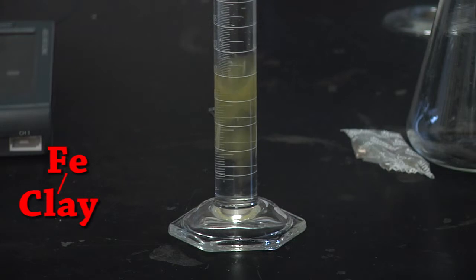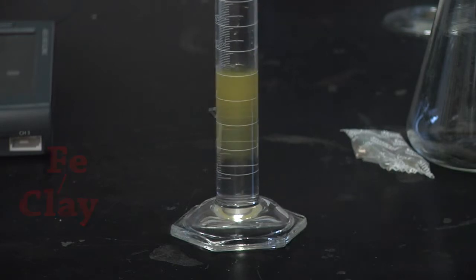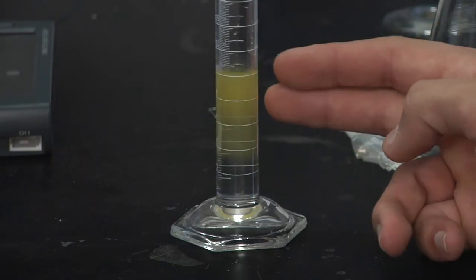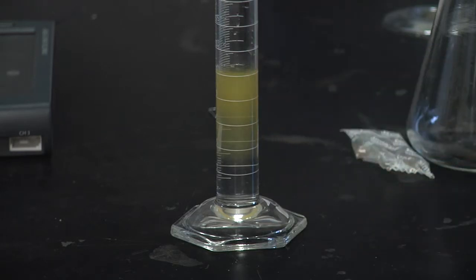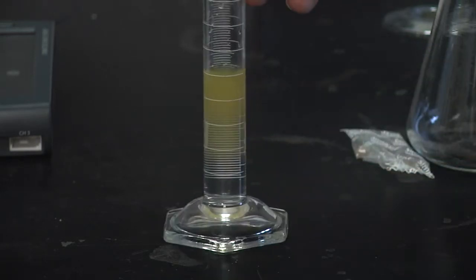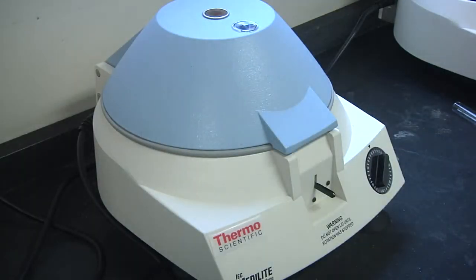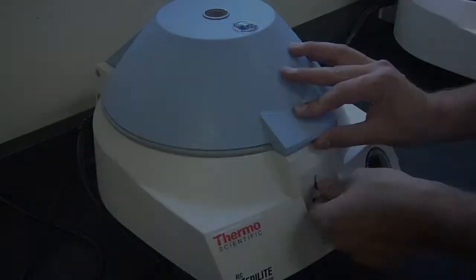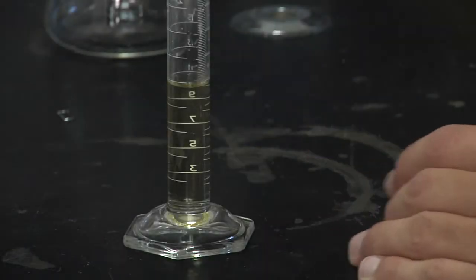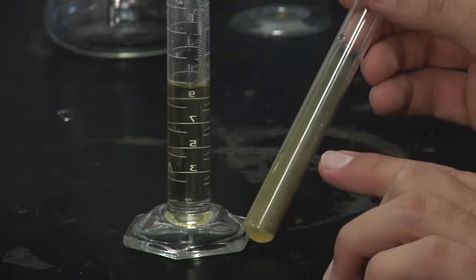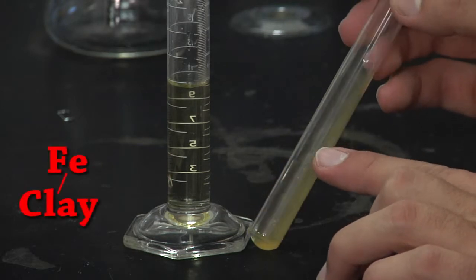Obviously you will not be doing this in this vessel; this is only for demonstration purposes. Once mixed, we can run this through our centrifuge. You may not be able to see the difference, but trust me, there is plenty of iron and clay left behind.